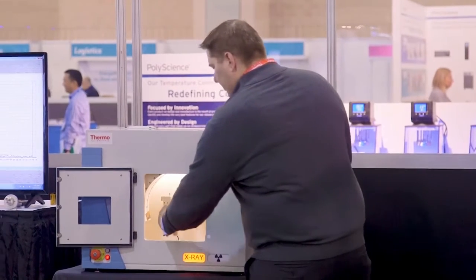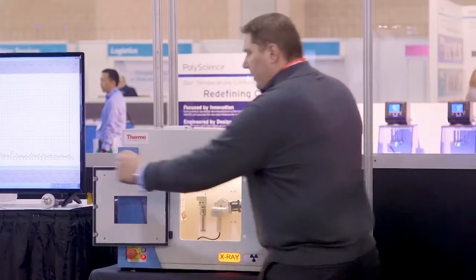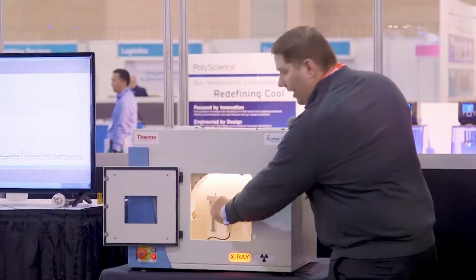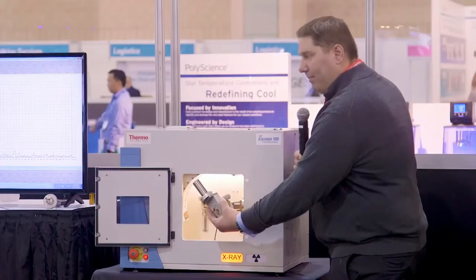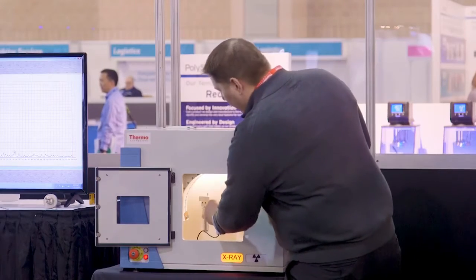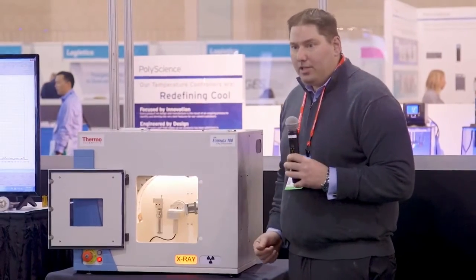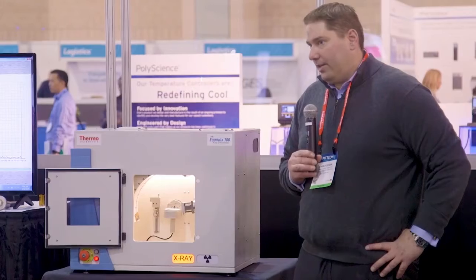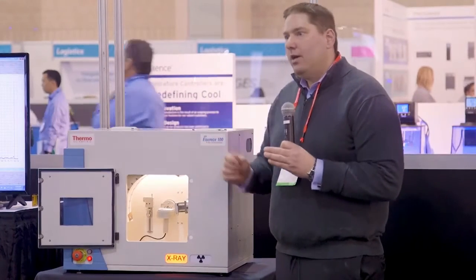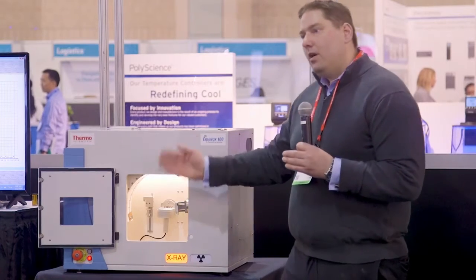Again, to change out any of the accessories, it's pull out, plug in. So we can put every kind of accessory on here, from sample spinning to non-spinning. Again, same sample holder for transmission and reflection, as we have a hole straight through here that we can put a Kapton-based window in. I can put in a thin layer stage. So if you're looking at layer thickness and roughness, I can actually do this on a benchtop. We can do a capillary stage on this benchtop. I can do a controlled atmosphere on this. So it is a Kapton window that's sealed. You can actually take it over to a glove box, prepare your sample if you need to, put it under an inert atmosphere, and put it back in here.